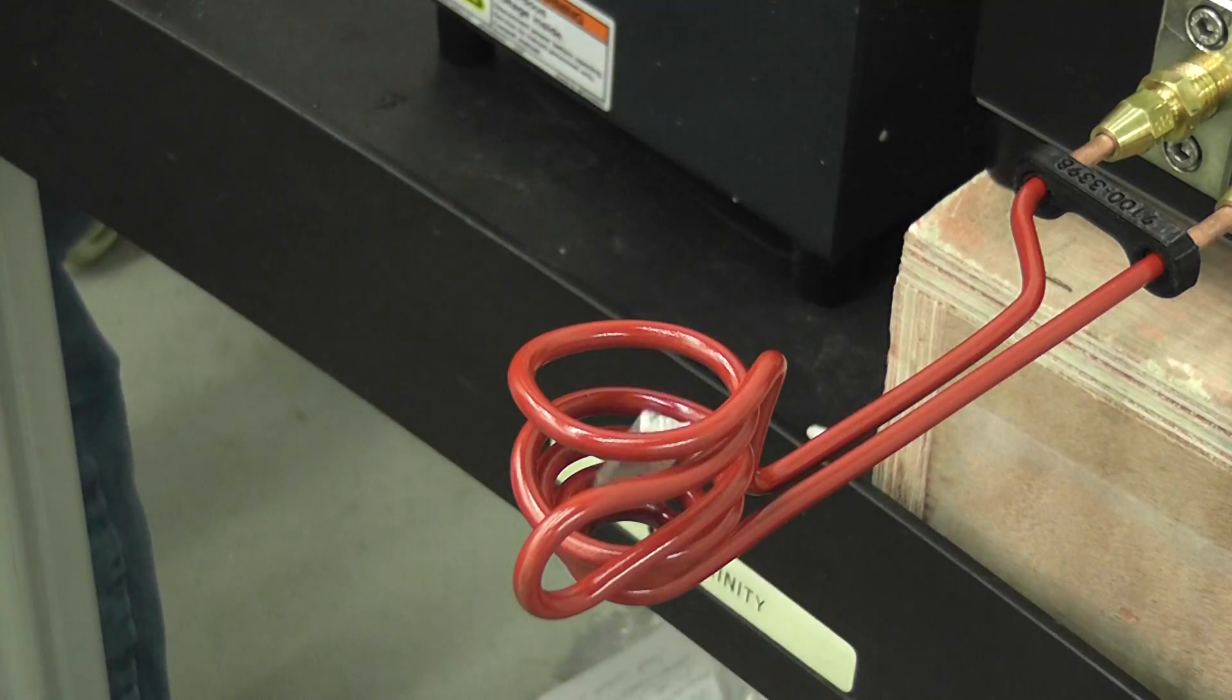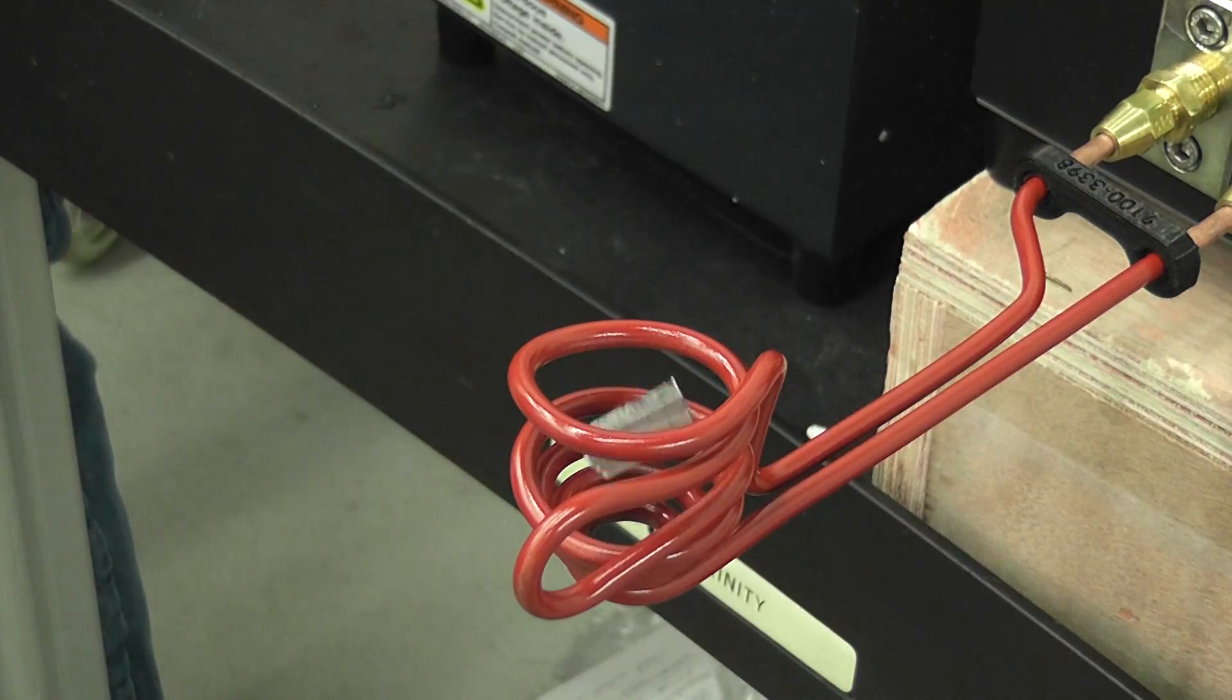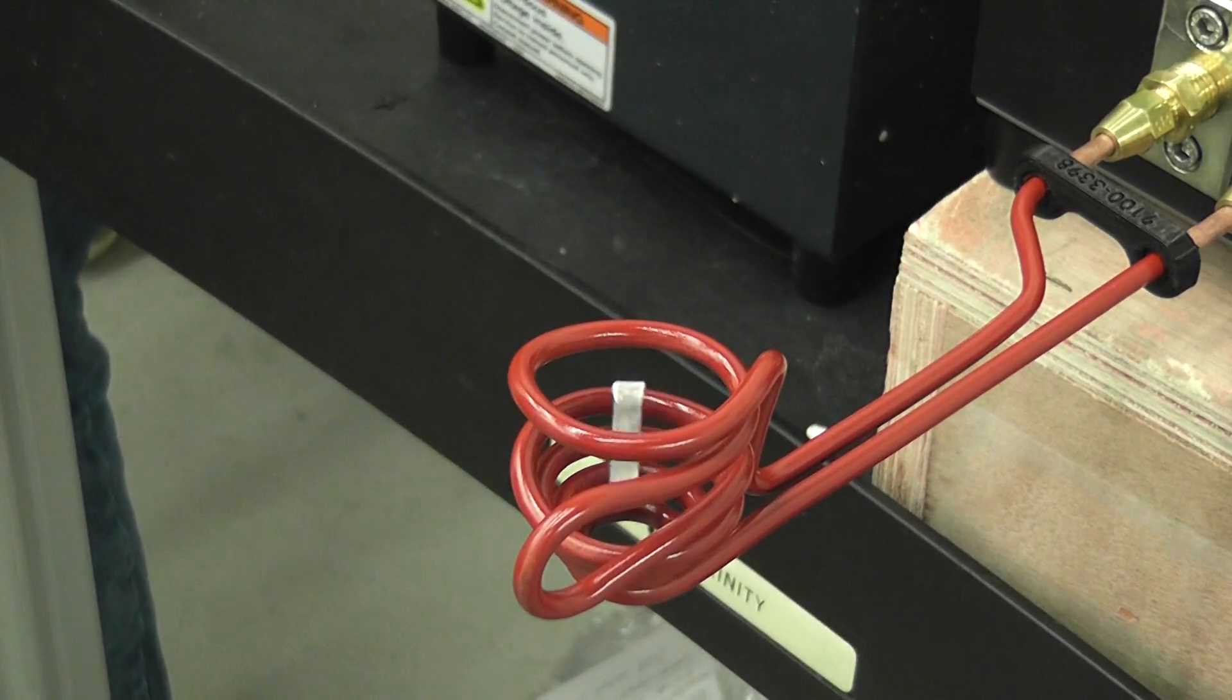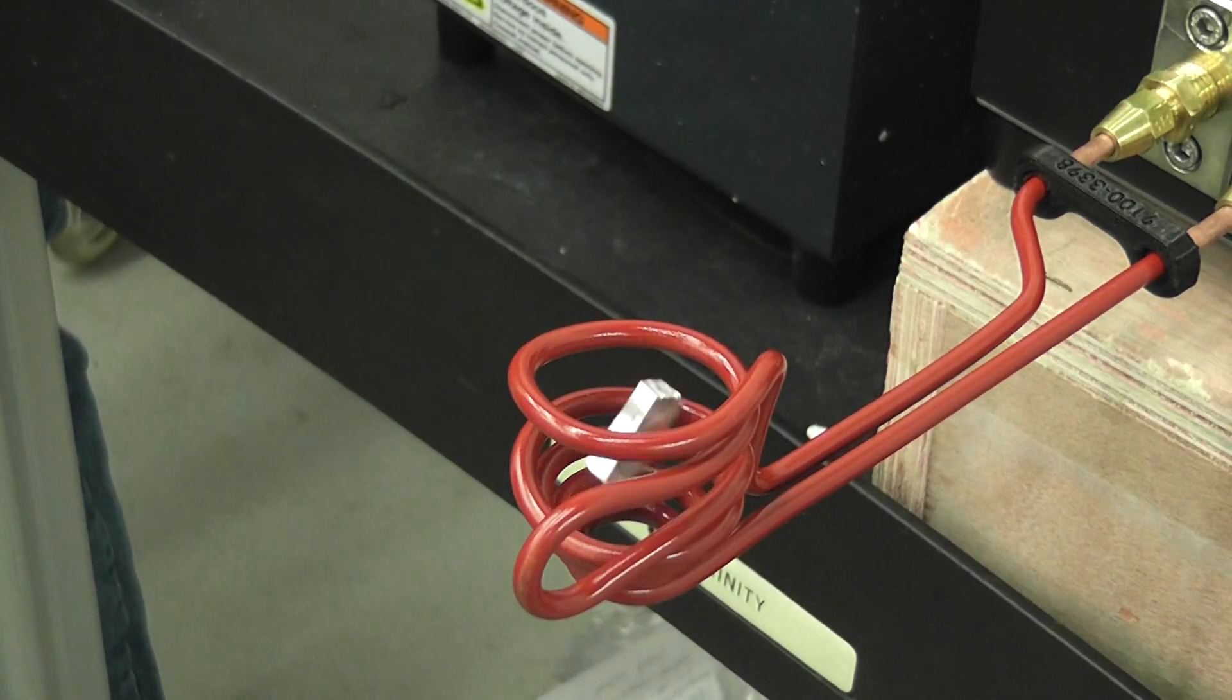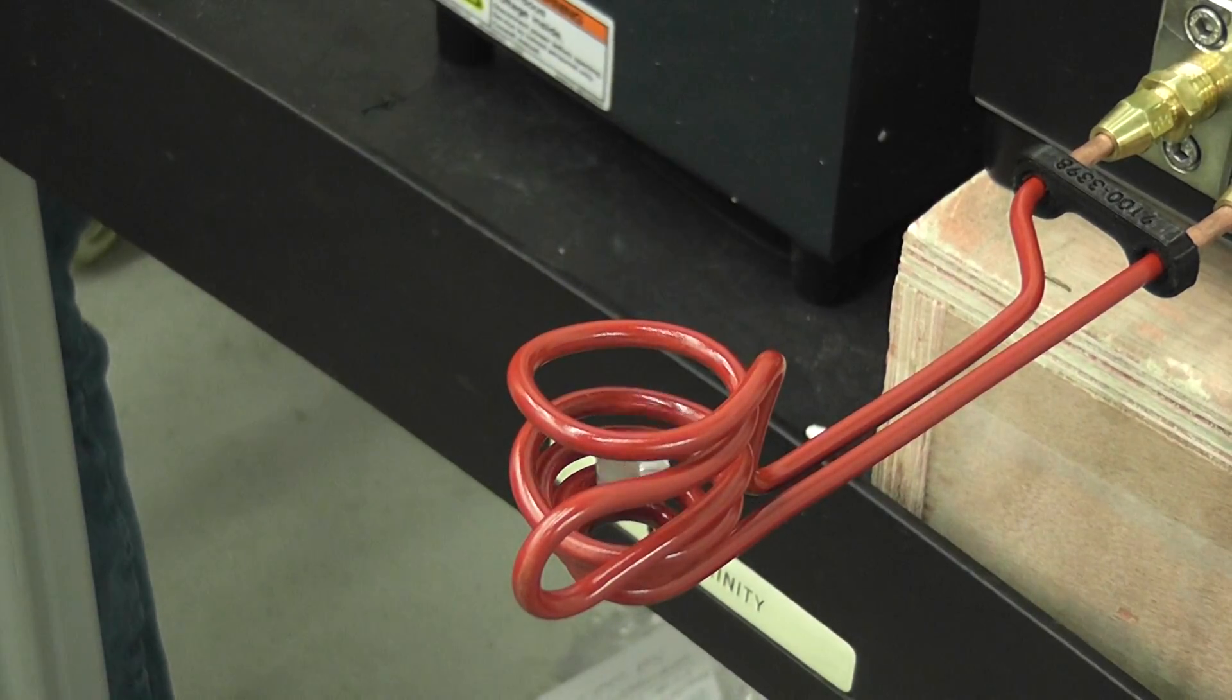I'm trying to get it a little bit lower in the coil when it's initially heating because that's where the flux densities are concentrated in the center. That top turn counterclockwise, so it's actually canceling a little bit. But once it starts to get hot, you need to put more current in and lift it because the resistivity starts changing.